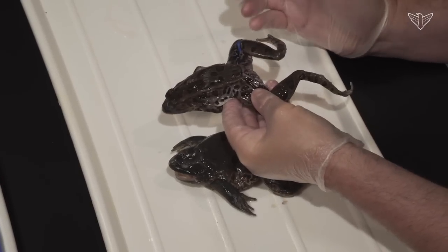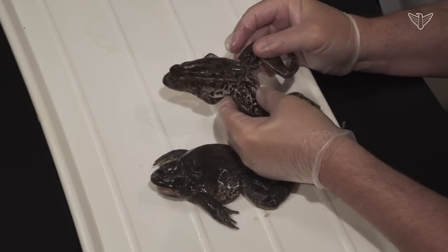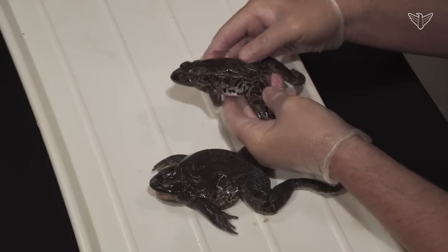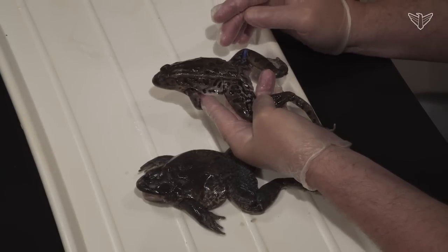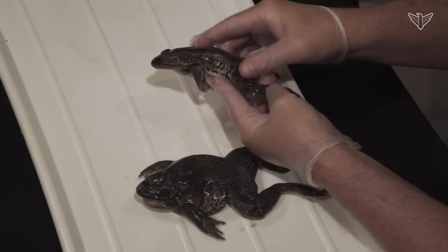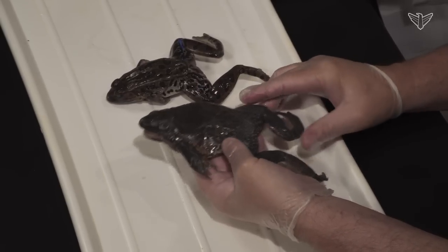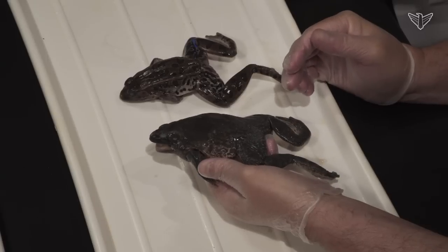These are two kinds of frogs commonly available from biological supply houses. This is probably the workhorse of biology — the one most people use. They're a little bit smaller: the northern leopard frog, sometimes called grass frogs, Rana pipiens is their scientific name. They have these spots, so they call them leopard frogs. You can also get bullfrogs, which are larger, might be easier to see structures, but they're more expensive. So you have to balance which one you want to use, depending on your budget.